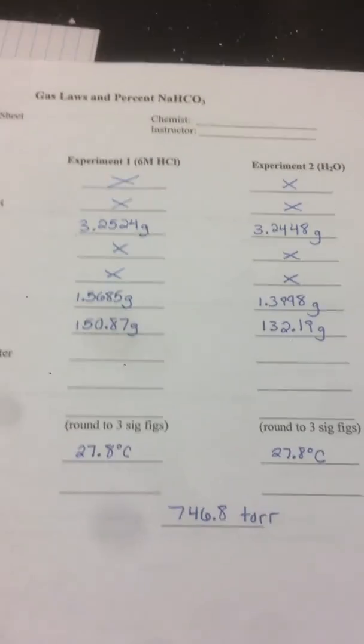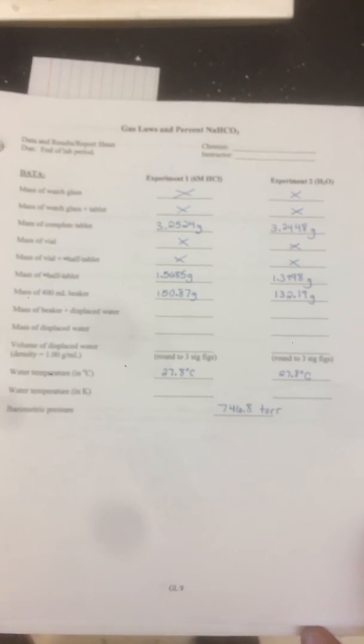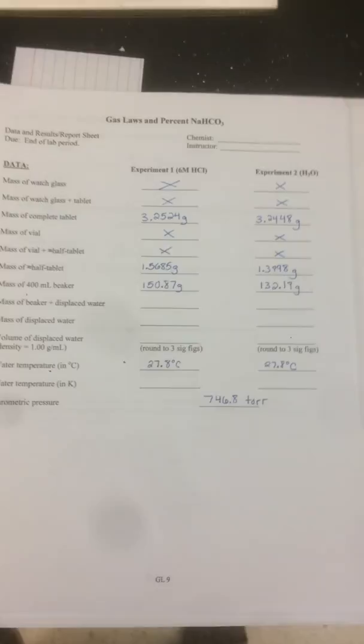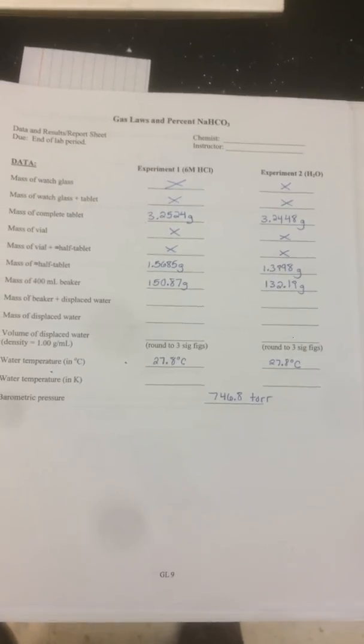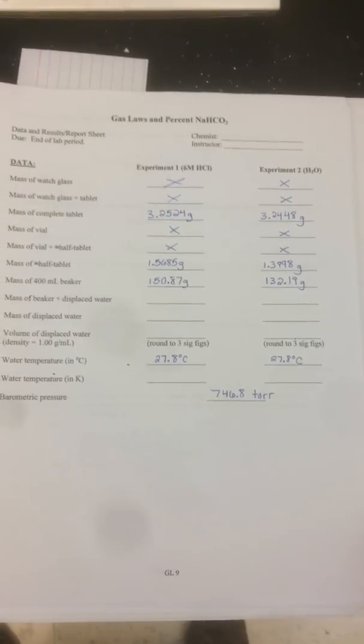All right, so I've weighed out everything. So if you can flip to your data table, this is going to be page GL9. Here are the data. Now, there's a couple of parts that you don't have to write in, so I've put that in with an X. All right, so what I'll do is kind of zoom out a little bit, and what you can do is maybe pause the video for a second and get all of these values down. Go ahead, pause it. Did you pause it?